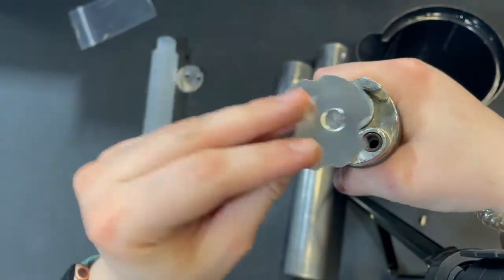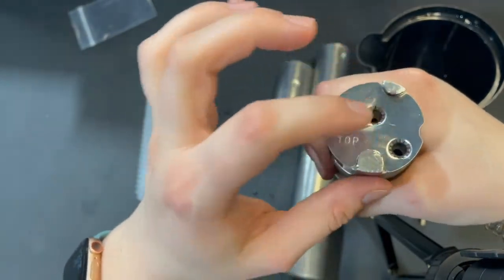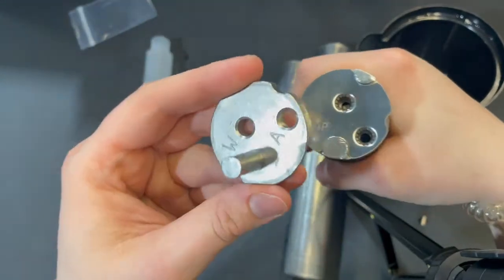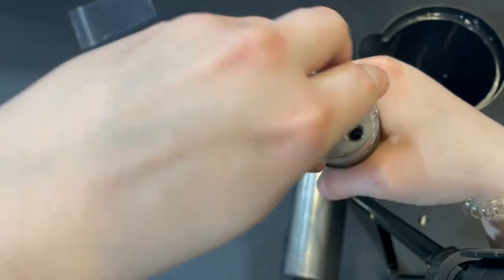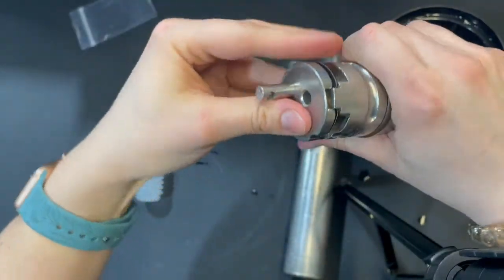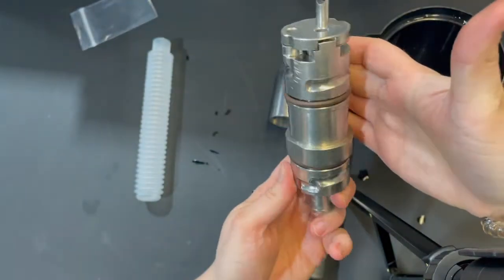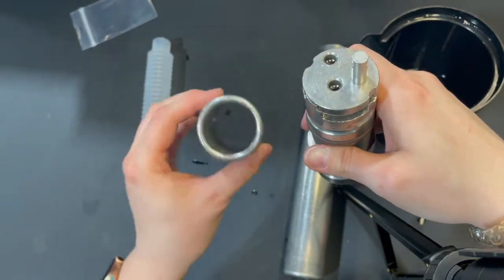Next, we're going to stick on our grab plate. You want to make sure that the pointed parts are facing down. There's also an indicator that shows what side is the top and the notches should align with the big and small notches on the top. Same thing goes with the very top of the assembly. That should snap down. Again, the grooves only go one way and you'll have that metal piece protruding from the top.